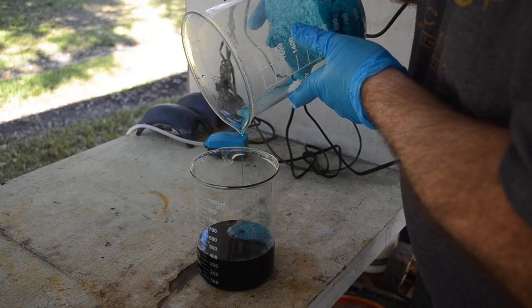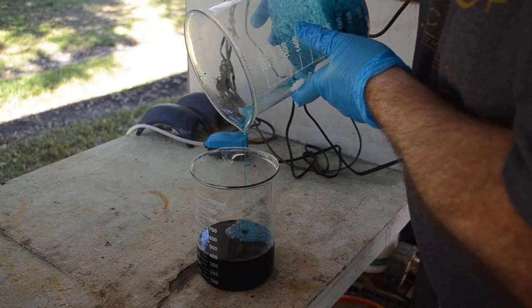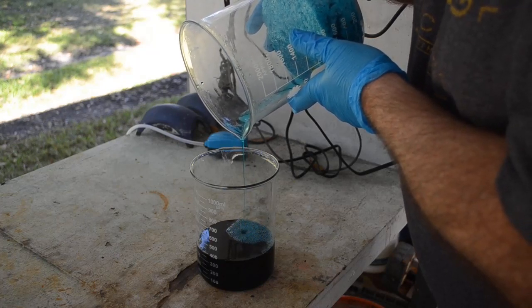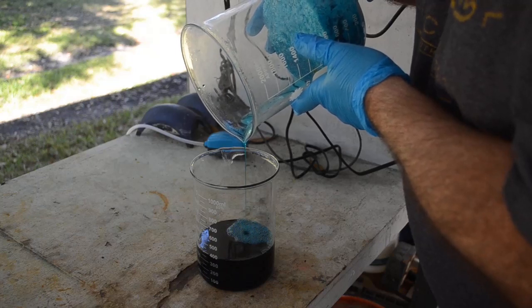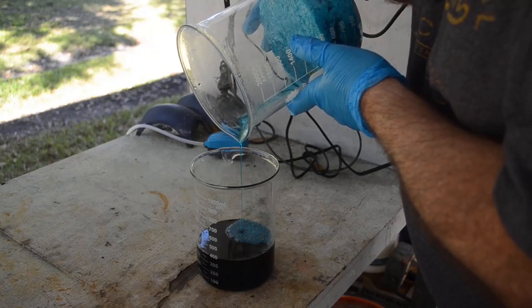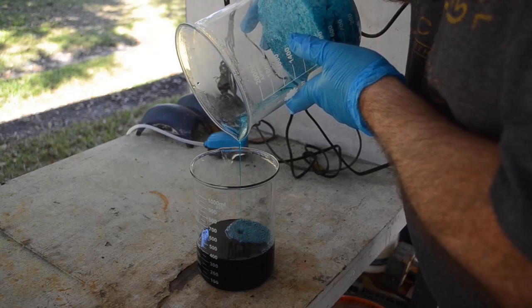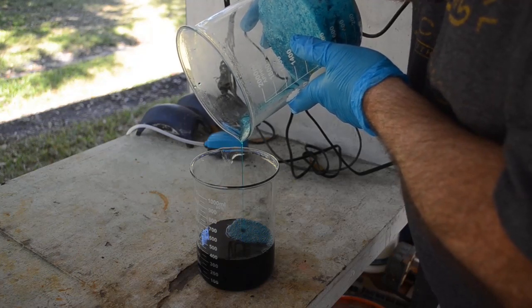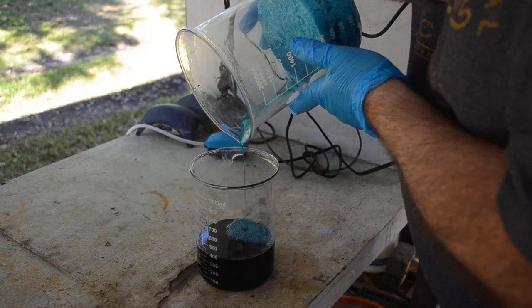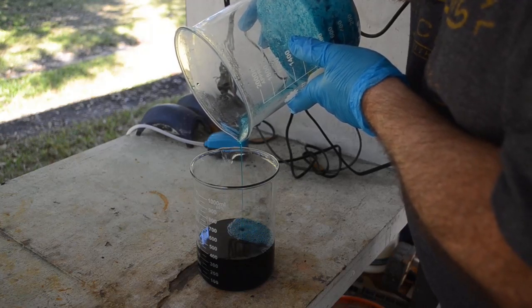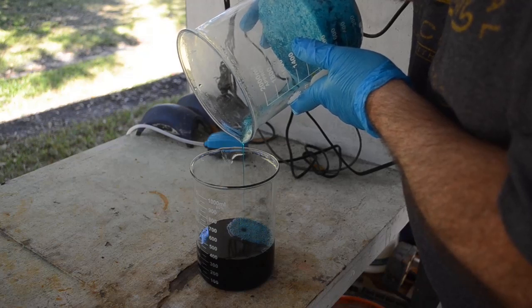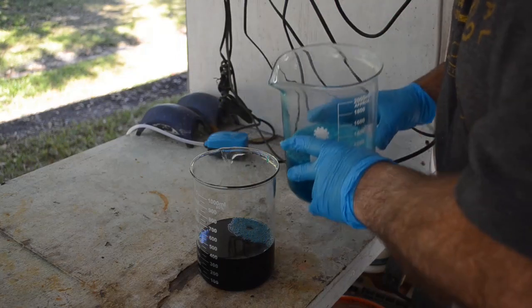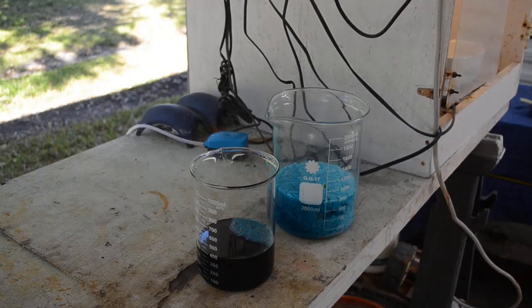But, what I will do is I will put this liquid on low heat and let it continue to evaporate. And, I suspect we'll get a lot more crystals this way. And, I've got all these nitrate salts now. I ought to be able to turn them back into nitric acid with a little luck. Get some of the expensive nitric acid back that I used to process those chips and produce these crystals.